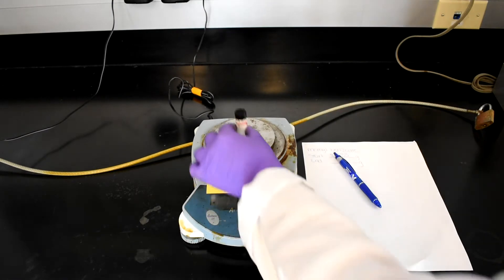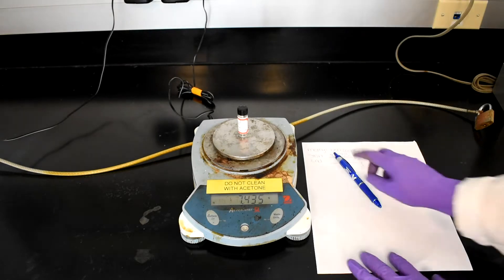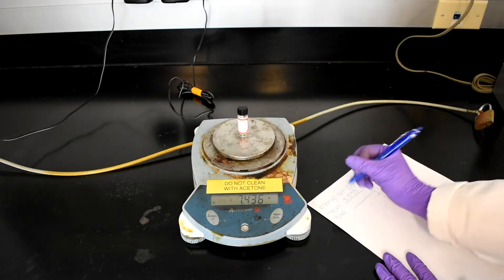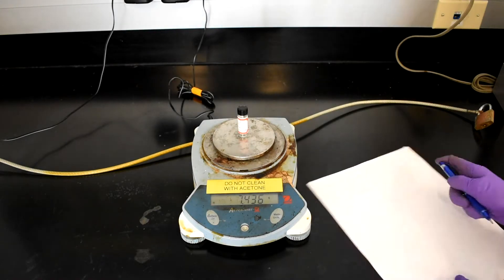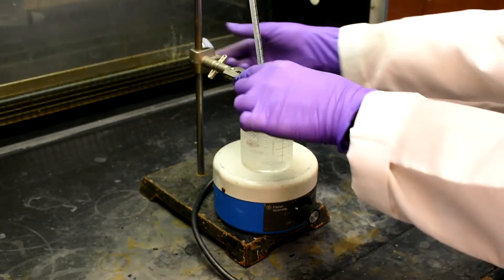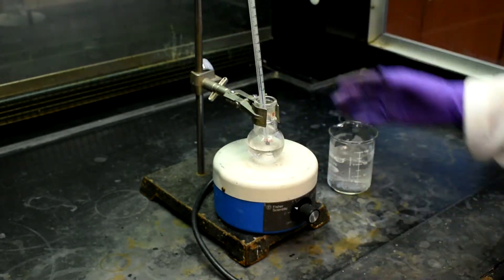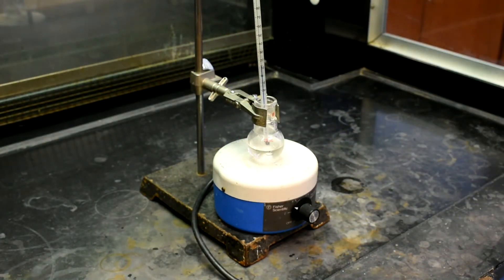After the addition is complete, weigh the empty vial. Make sure your TA is present to sign your practical performance report. Remove the reaction flask from the ice bath and allow the solution to stir without cooling for an additional 15 minutes.